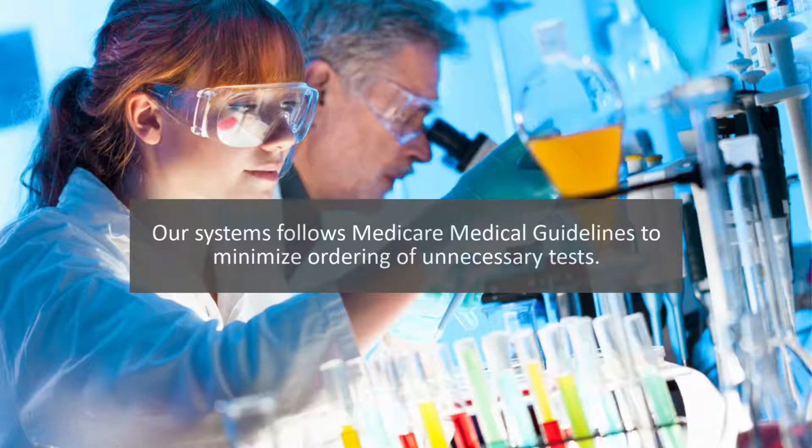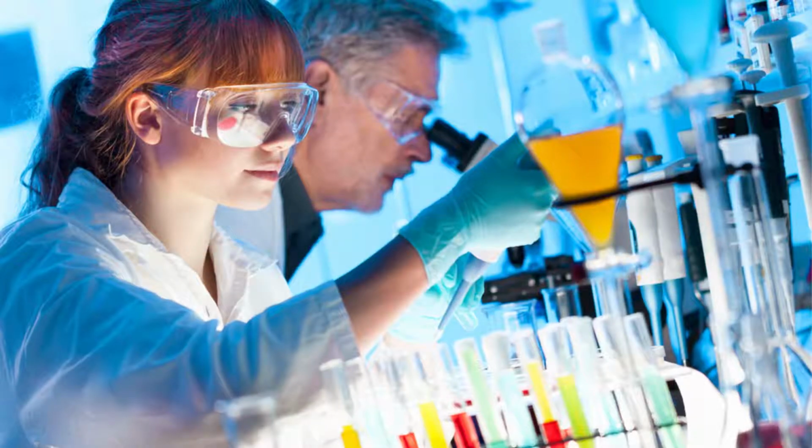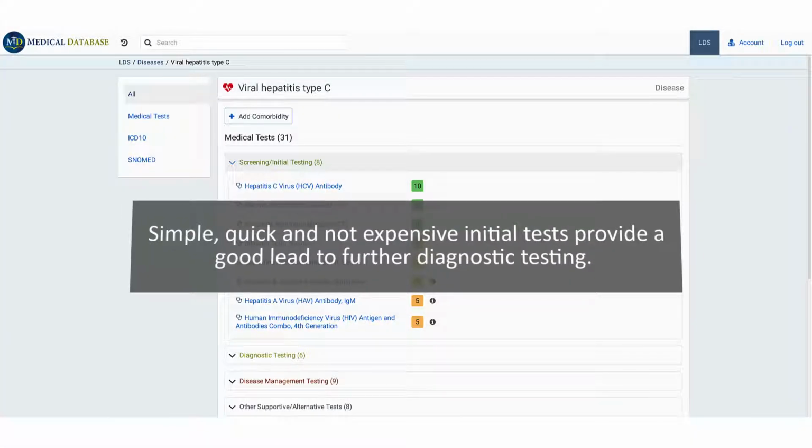We use the following test indications: screening and initial testing, diagnostic testing, and disease management testing. This testing indication will give physicians a good start with the most likely disease-related testing to get more findings to nonspecific presented symptoms. Therefore, selected tests are usually simple, quick, and not expensive, and will provide a good lead to further diagnostic testing.